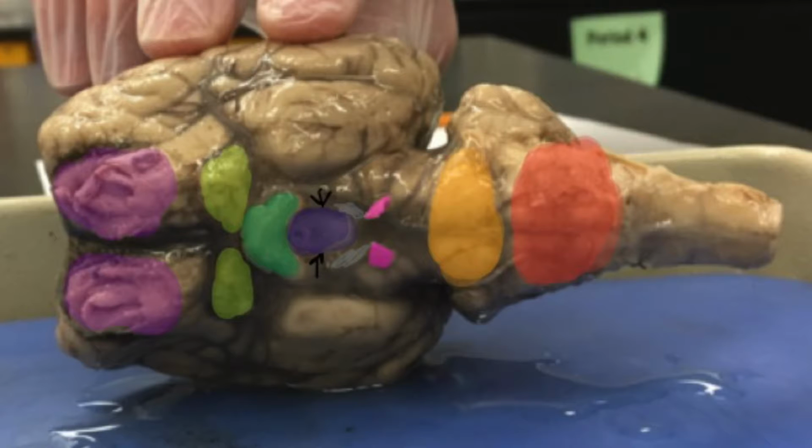The olfactory bulbs are a pinkish-purple color. They are located near the nasal area and are involved with the sense of smell. As you can see in these images, they are located at the front of the brain because the nose is in the front of the head. The olfactory bulbs in sheep are so much larger than the ones in humans because of the heavier reliance animals have on their senses. Black arrows point to the cranial nerves.